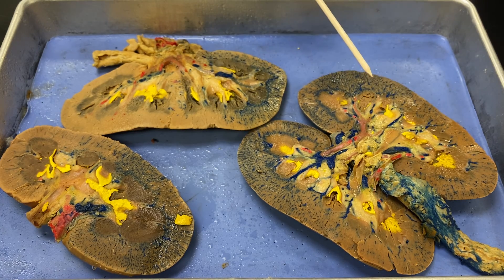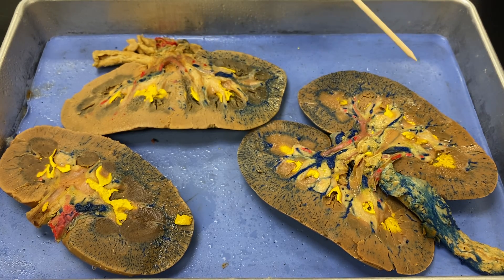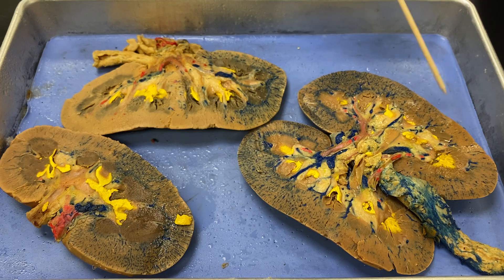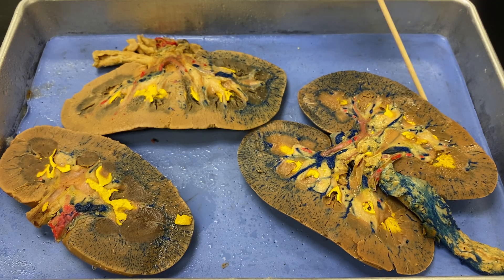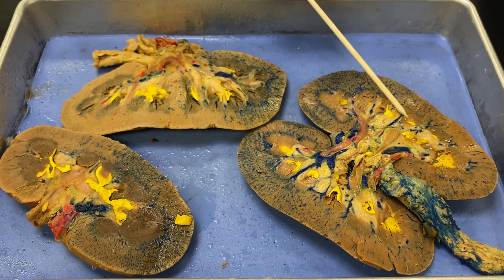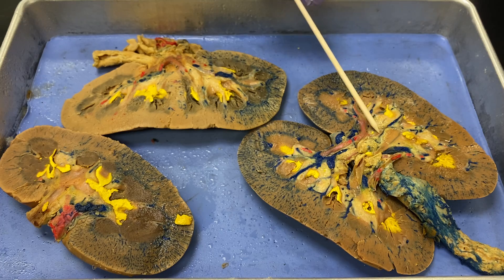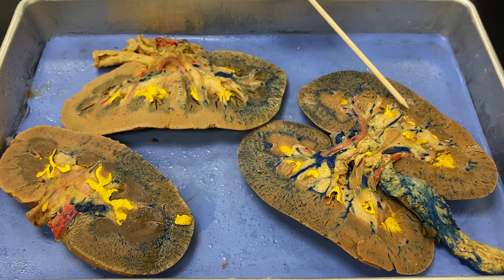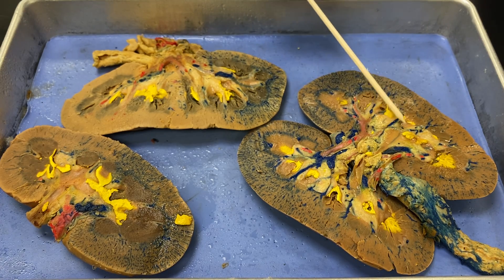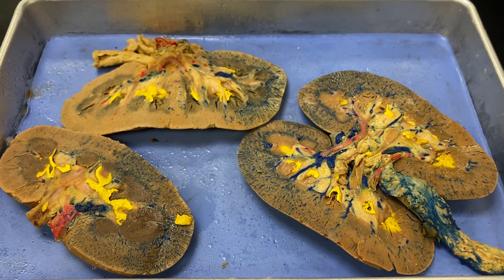You can't see everything that you can see in the model. Models are very stylized, idealized. But you can see the outside of the kidney, which would be the fibrous capsule. You can see this region right here, which is clearly a different color than this region right here. So this is the cortex.